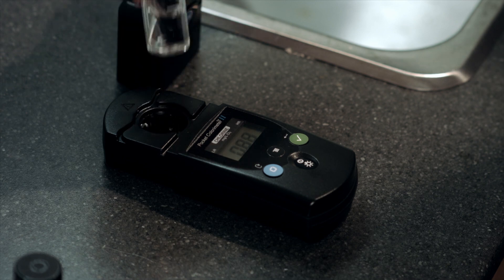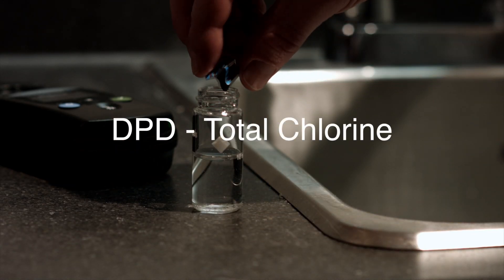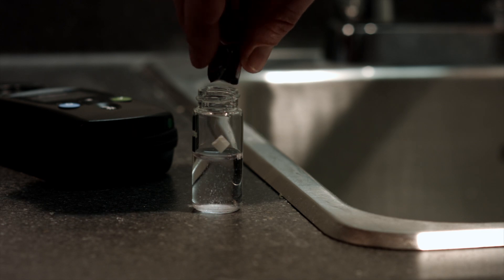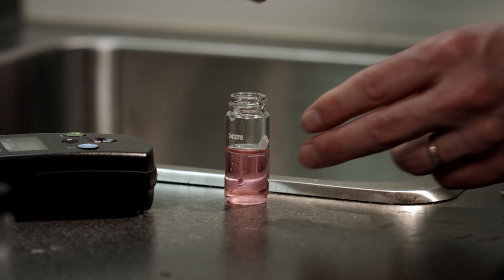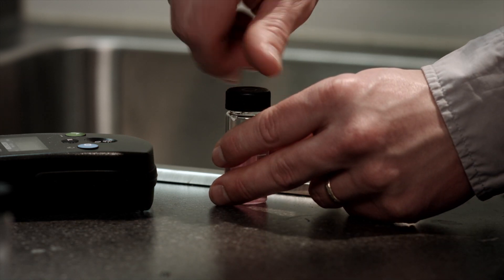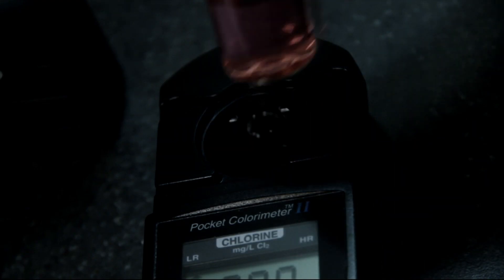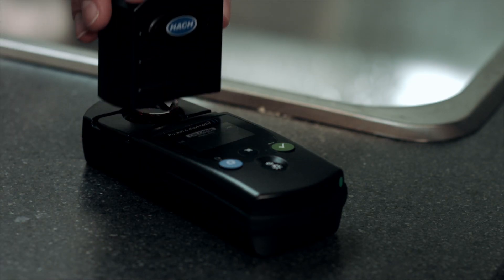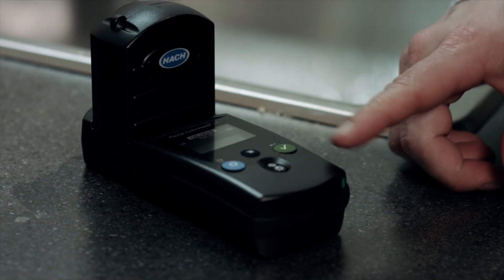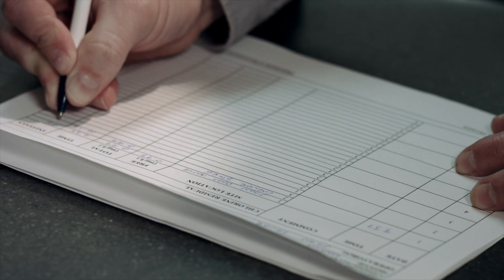Remove the bottle from the meter and add the chemical reagent from one DPD total chlorine packet. Replace the cap on the bottle and shake for approximately 20 seconds. Wipe the bottle and place it back in the meter with the diamond facing the keypad. Wait three to six minutes, then cover the meter with the instrument cap, press the read key, and record your result on your log form.